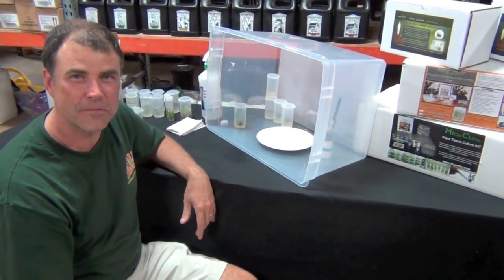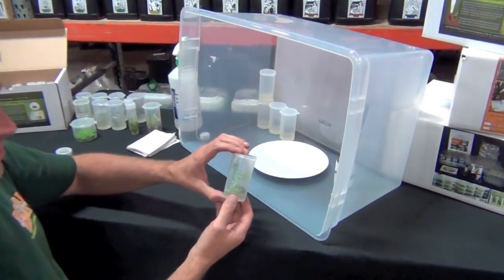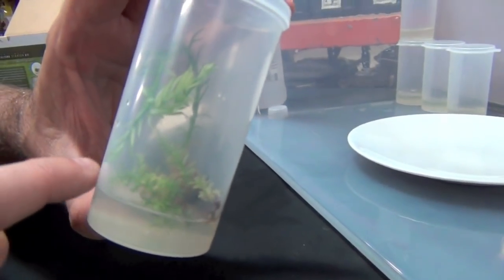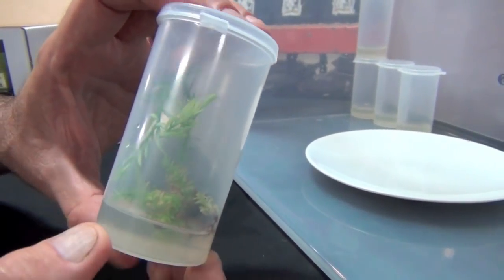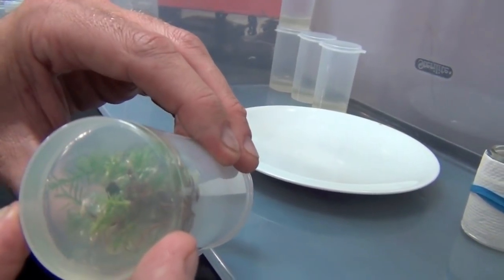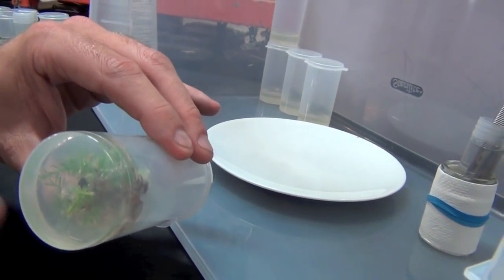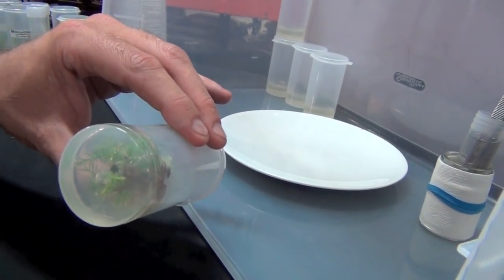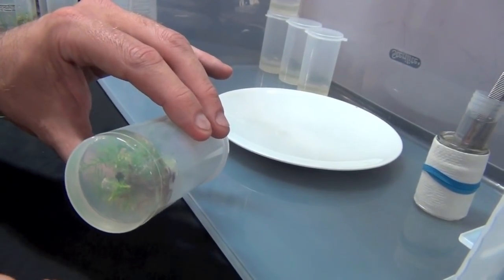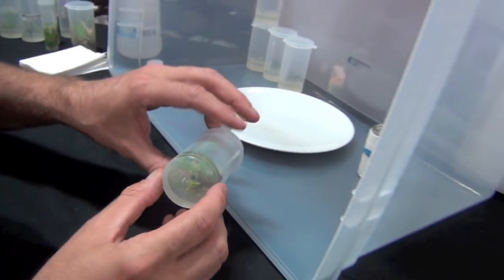I was just about to take some tissue culture plants out, cut them, and put them into new tissue culture tubes. This is our redwood, about six weeks old, and obviously so big that it bent over in the tube. You can see little plants popping out all over the place down here — this is already split into two. Since each plant piece I need is only an inch long, I have about five or six of them just from that long one. Looking at it from the bottom you can see the different plants coming out in all different directions. This is the multiplication hormone — the cytokinin — and the hormone I'm using here is the opposite of rooting hormone. What it's doing is keeping the plant from growing roots, keeping it short, so the nodes are tight and giving me lots of multiplication sites.